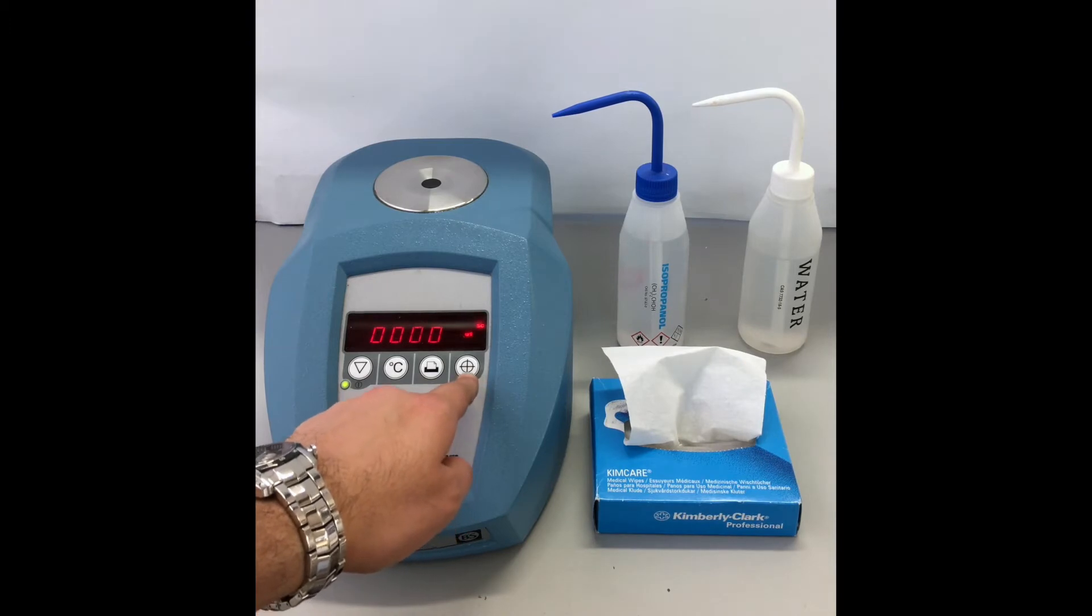Finally, this is the calibrate key. Hold the button for 3 seconds to re-zero the machine using distilled water.